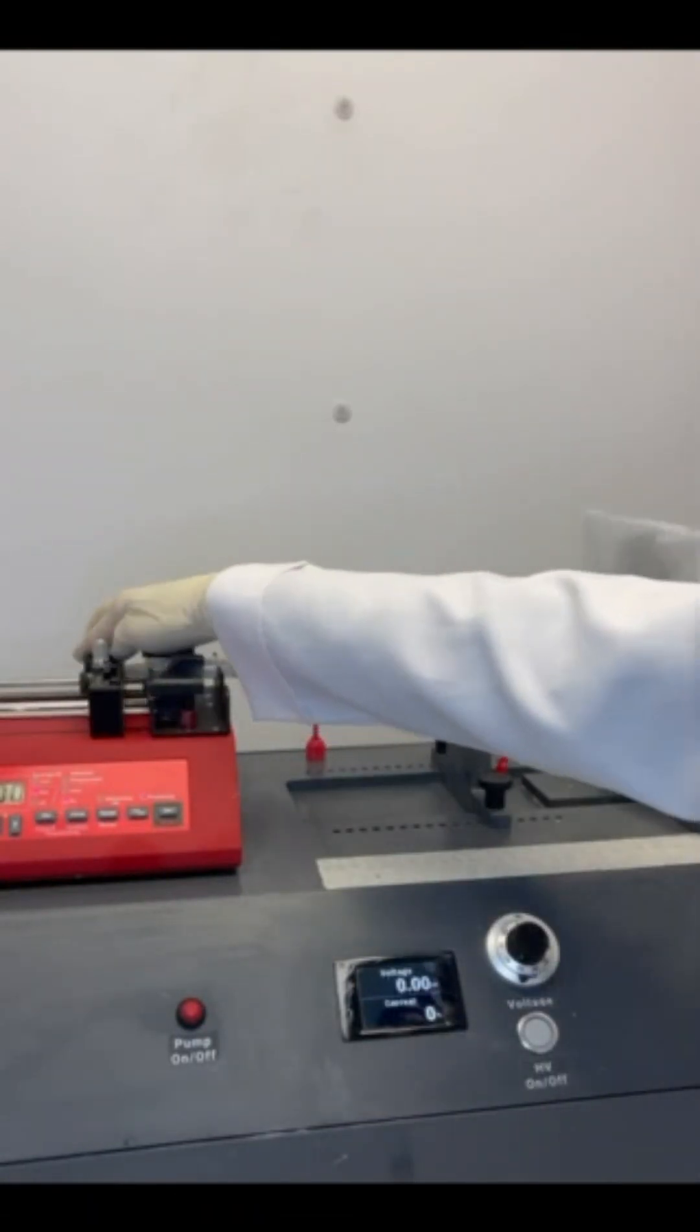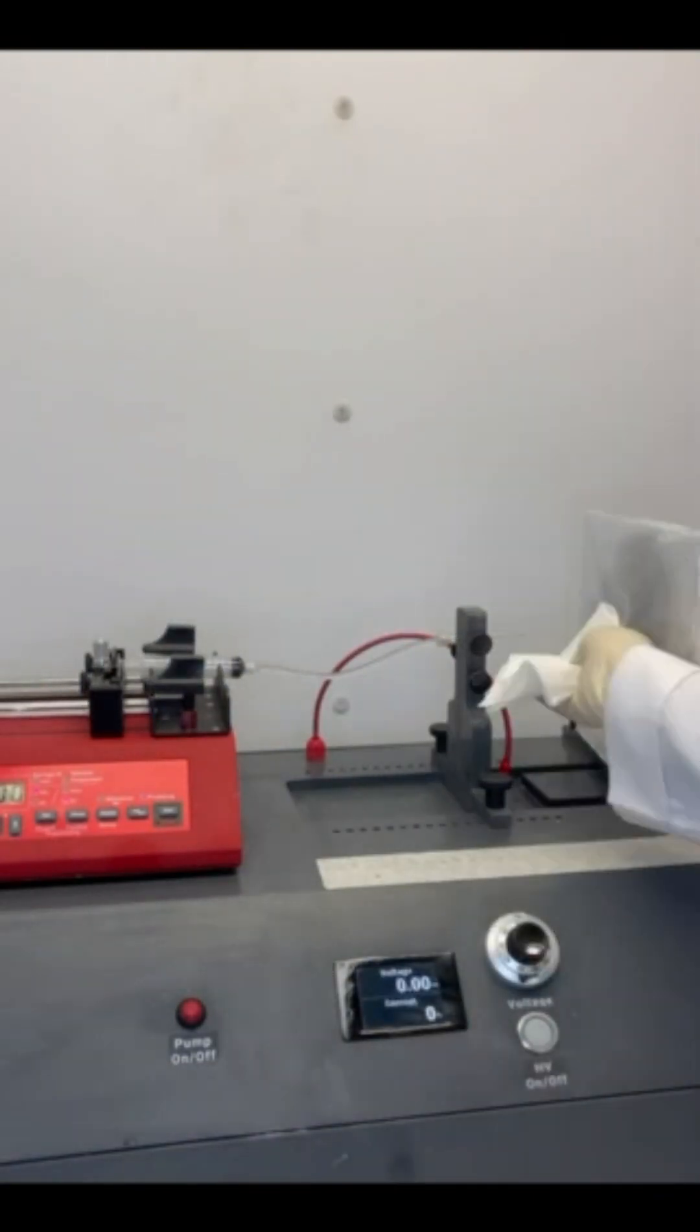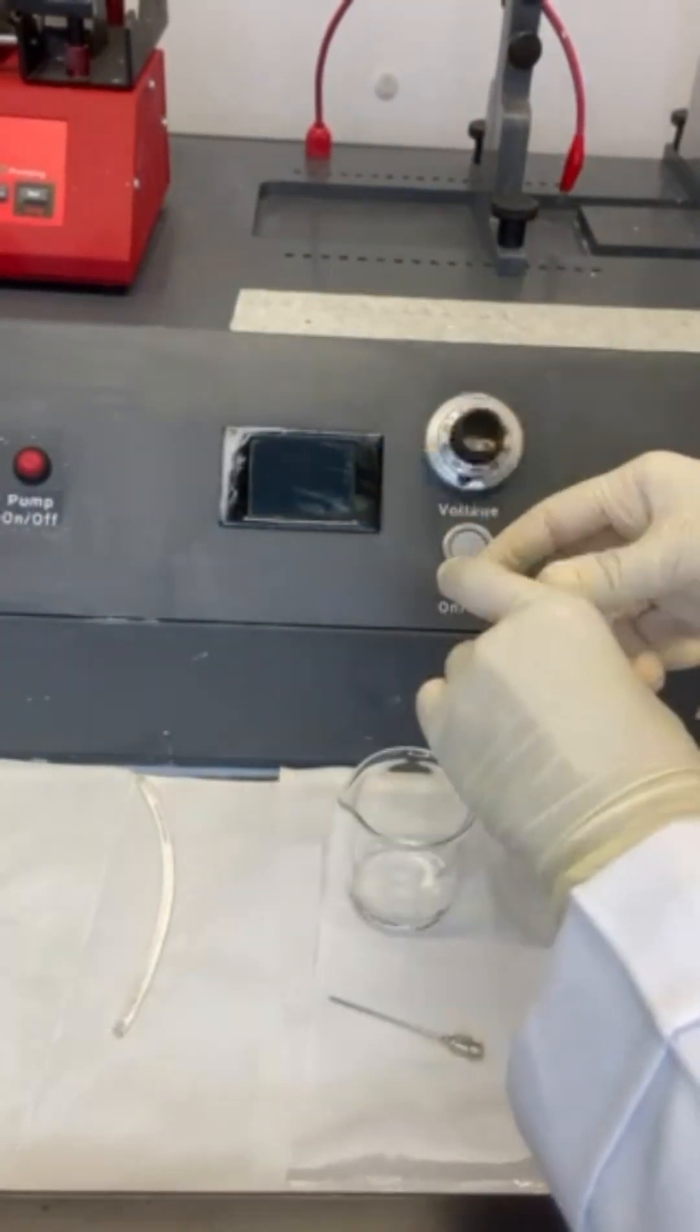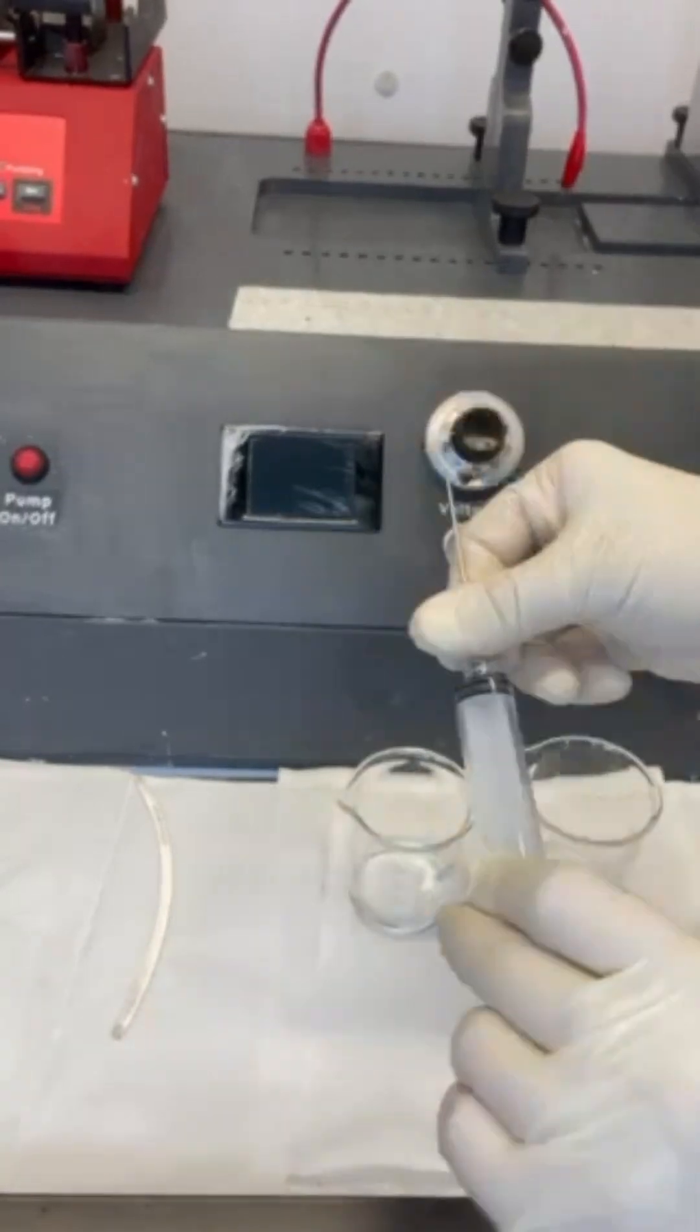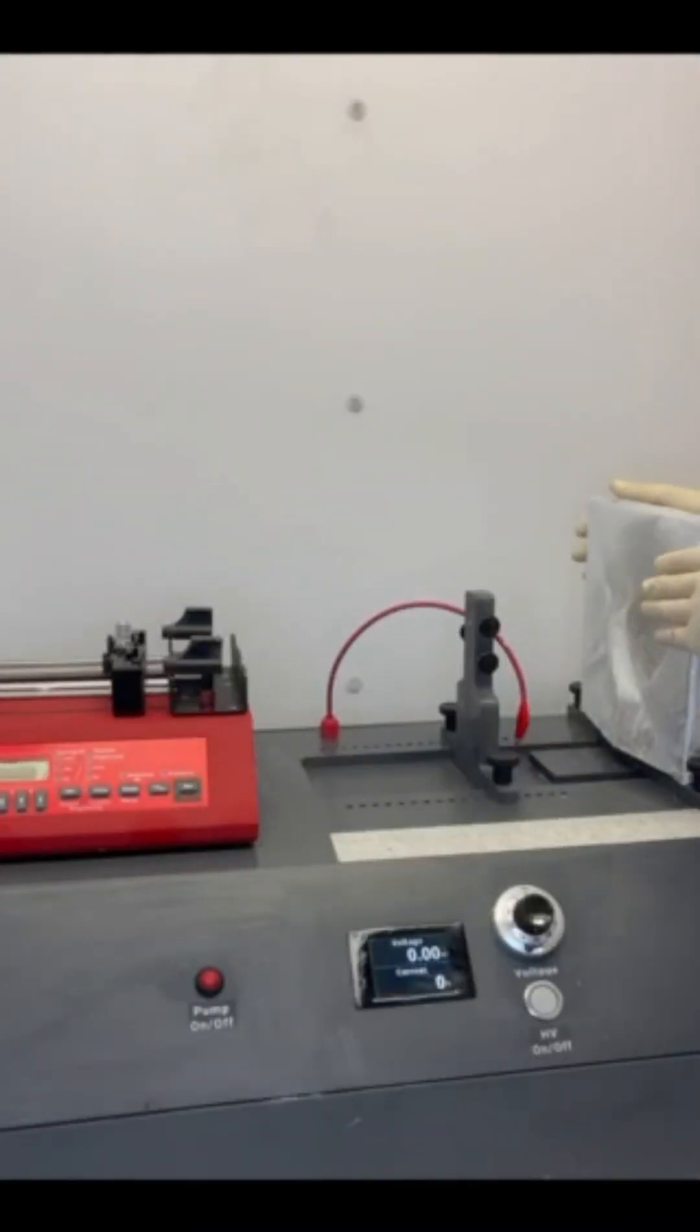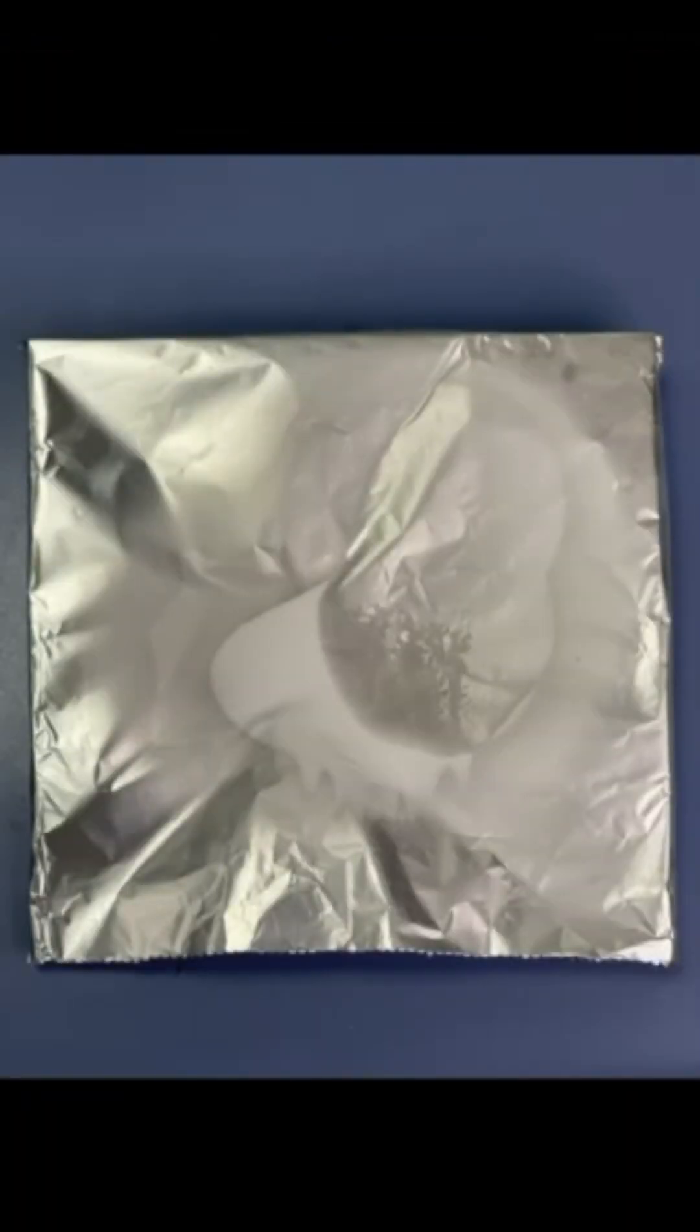After three hours, we make sure the needle is clean and use solvent for that, which is DMF. Finally, dry the membrane overnight at room temperature.